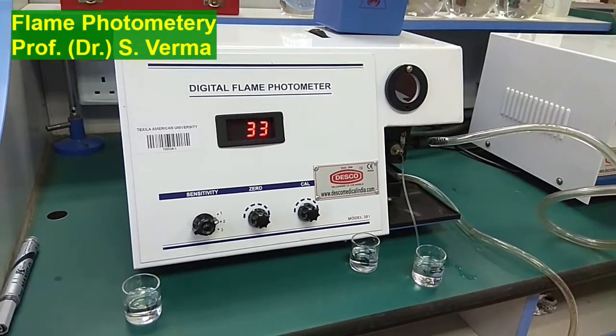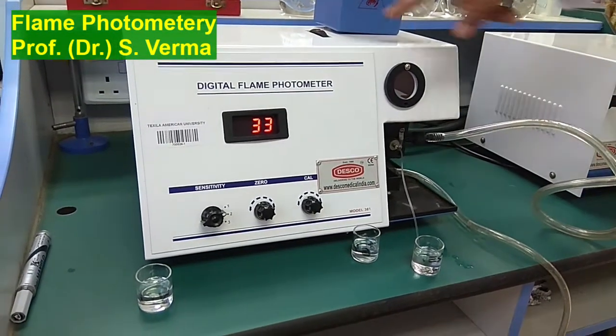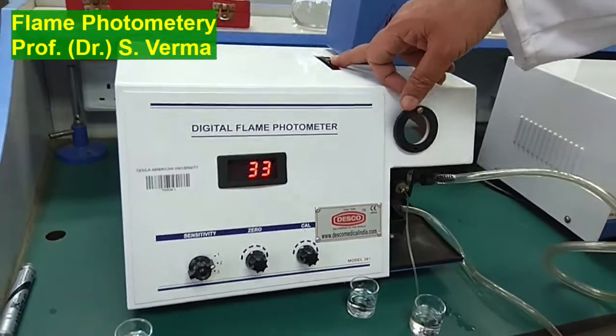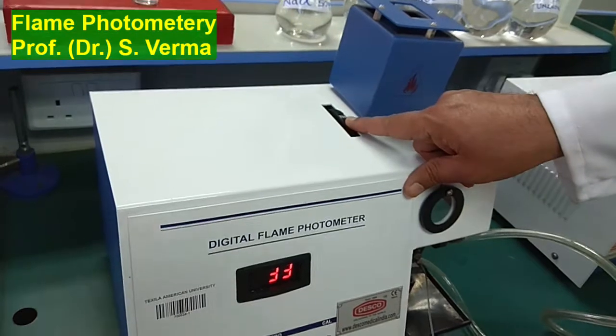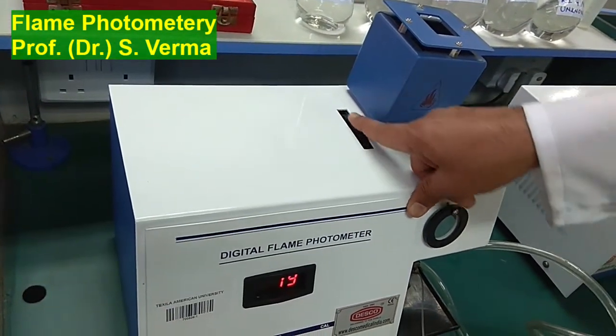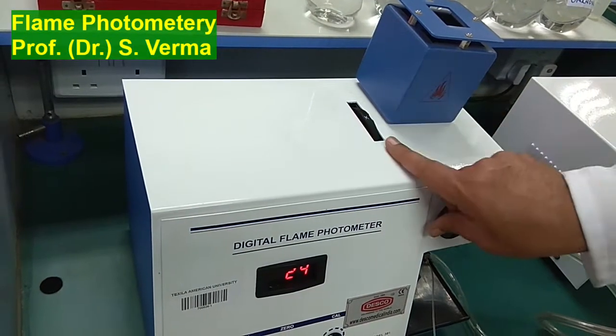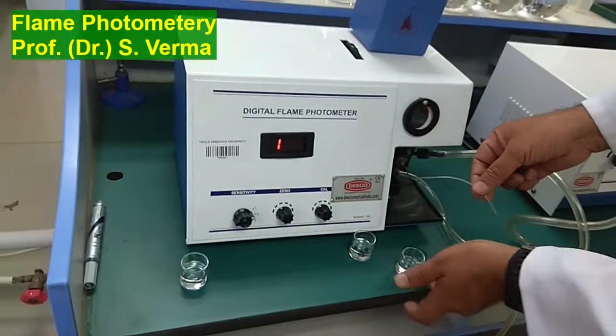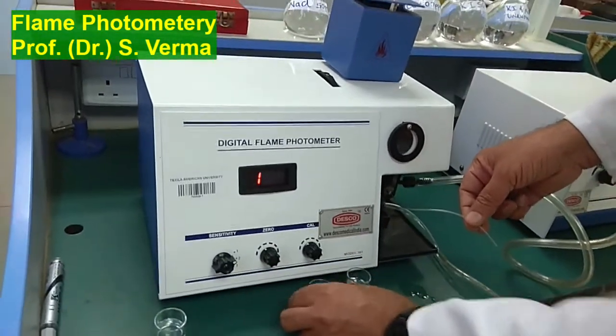So that's about it. So we work with sodium. It's giving result for sodium because the filter is at sodium. So for the next part of the experiment is to find out the concentration of potassium. So I'm putting it on potassium filter. So this is now on potassium filter. I'll take out this capillary tube and I'll go with the same series of steps.